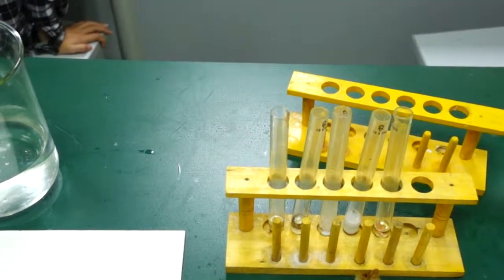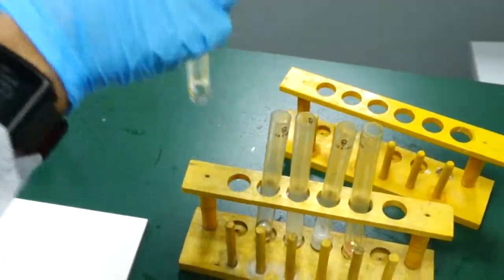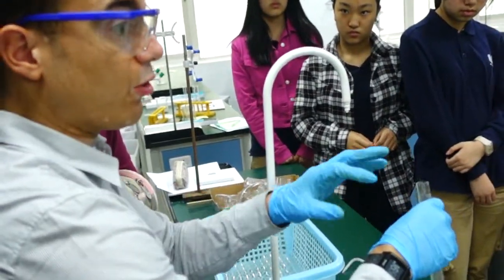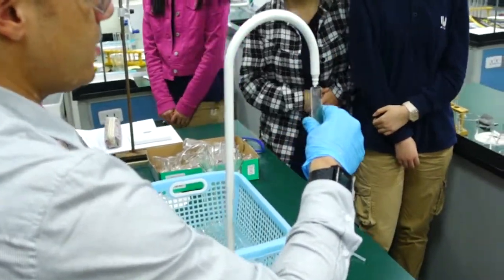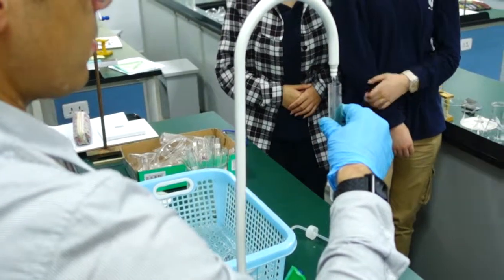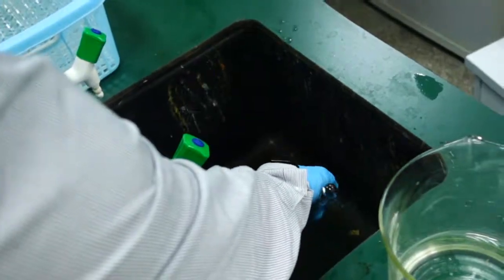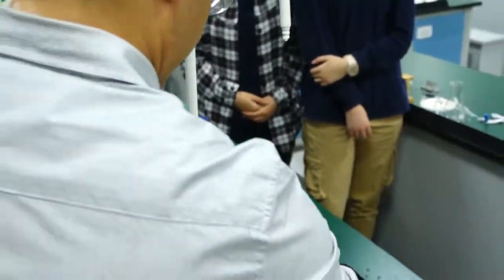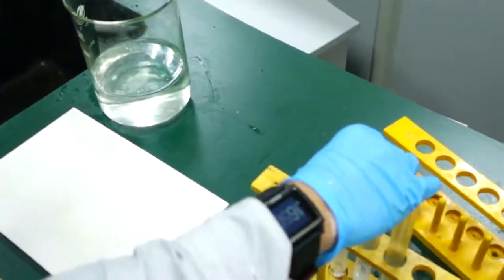You smell the fumes? Yeah. Right, so this is strong acid. I don't want to just put it down the sink like this because it will corrode things in the sink, so I will dilute it and dispose. Once we've... oh, these are still reacting, still going.